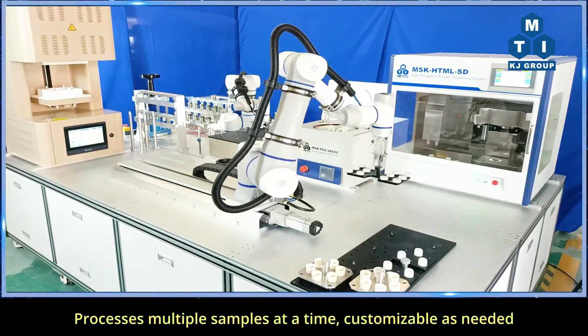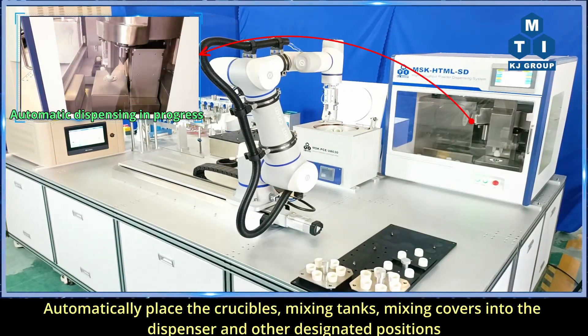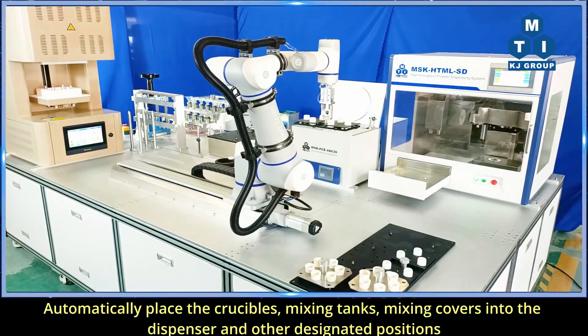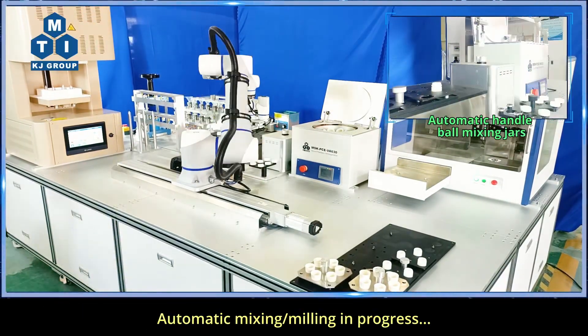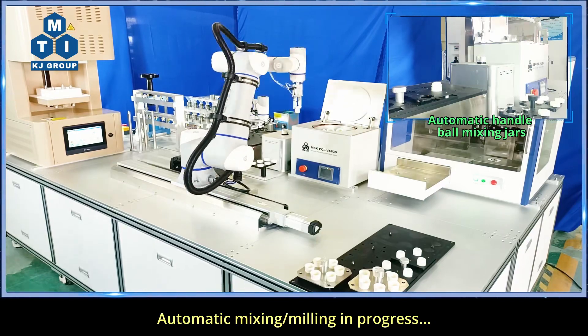Automatically place the crucibles, mixing tanks, and mixing covers into the dispenser and other designated positions. Automatic mixing and milling in progress.